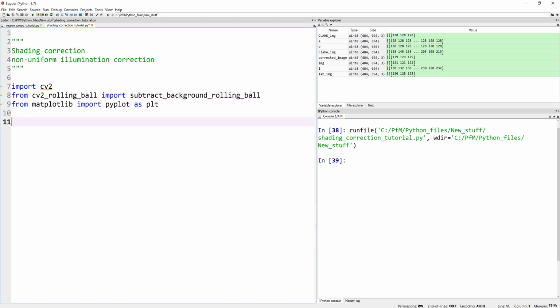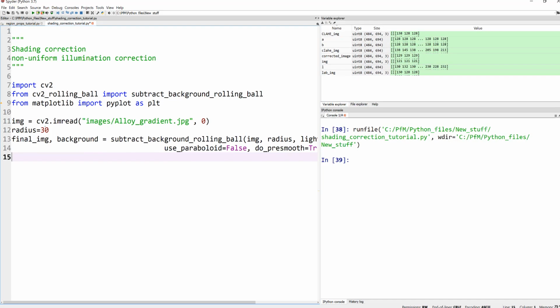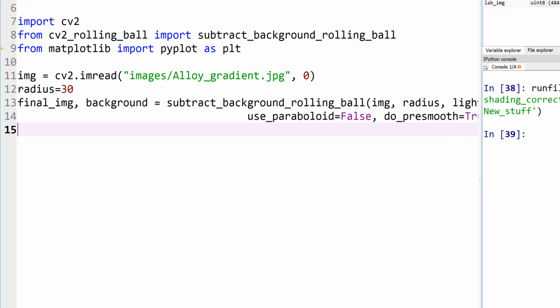So we're all set. Now let's go ahead and define our image. In fact, I shouldn't have erased my previous lines, but that's okay, I can copy and paste it. So again, we are reading our image. I'm reading it as a grayscale image here. Again, you could have done the tricks that I've done earlier. And I'm defining my radius as 30.